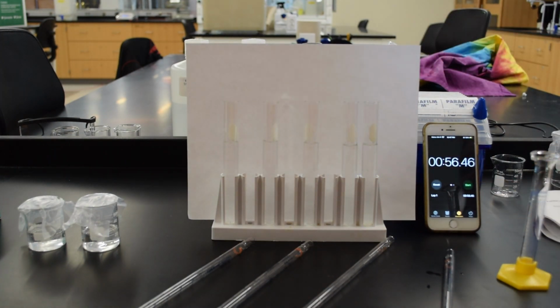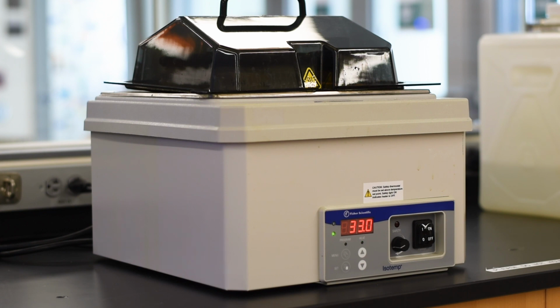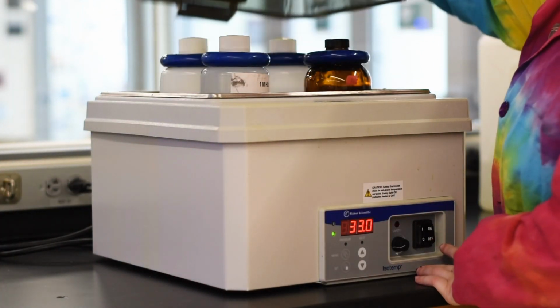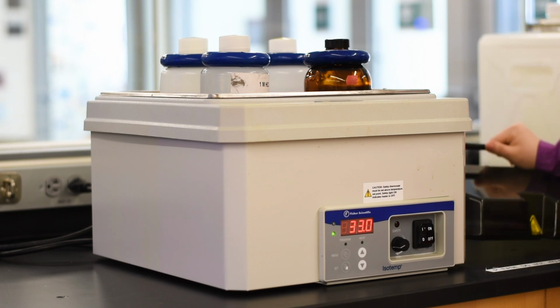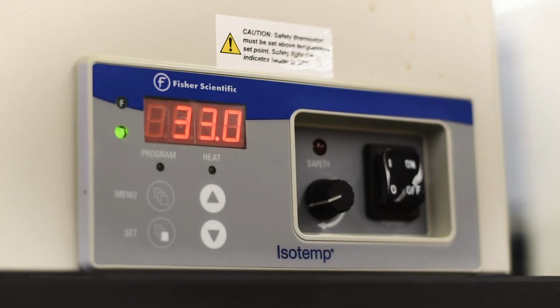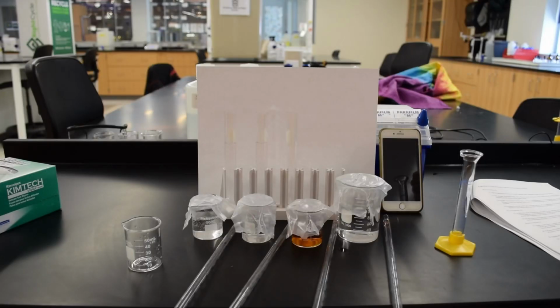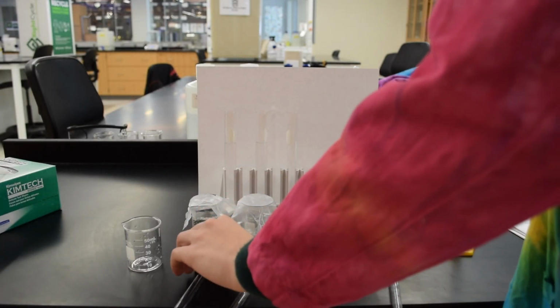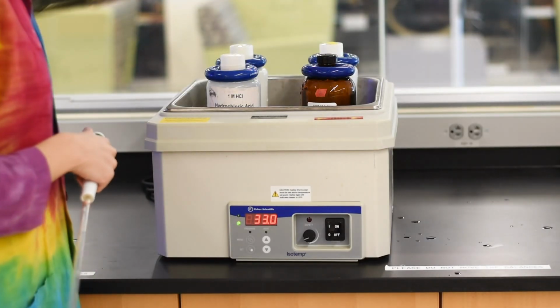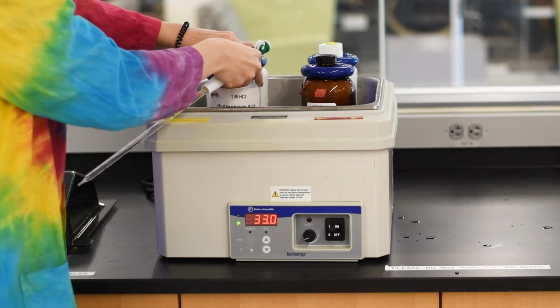Now in this final part, what we're going to do is you're going to take whatever solution took the longest time to run, and it's important you take the longest time, and then you're going to go over to the water bath, and it's set to a warmer temperature than room temperature, and you're going to recreate the experiment that took the longest, and you are going to grab your exact same pipettes and take the solutions directly from the water bath.